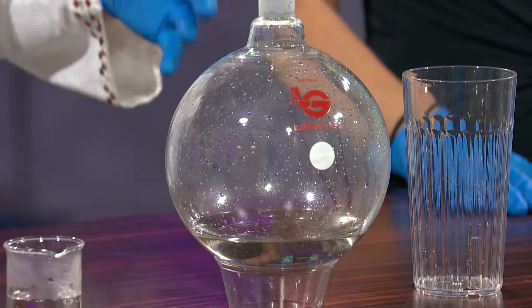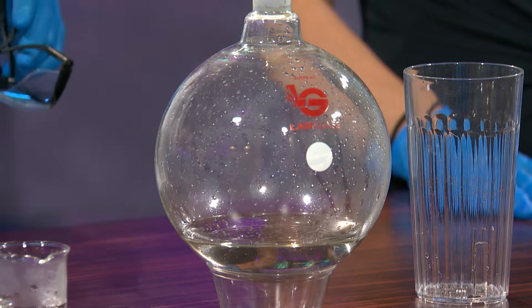We're gonna make Christmas ornaments with chemistry by using a process called plating — that means we're gonna put a metal onto a surface. This process is used to make Canadian coins, chrome rims, jewelry, and building materials. Today we're going to use a chemical process that usually uses electricity, but instead we're gonna silver this glass flask.